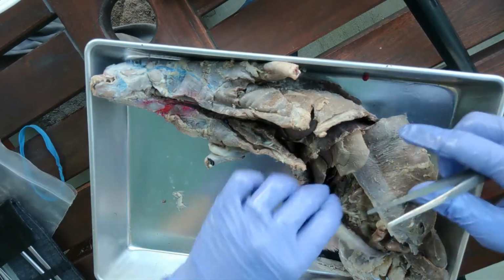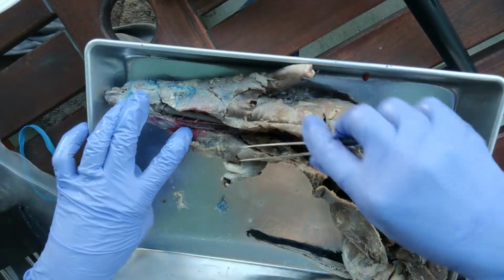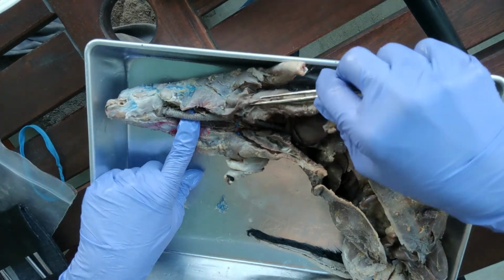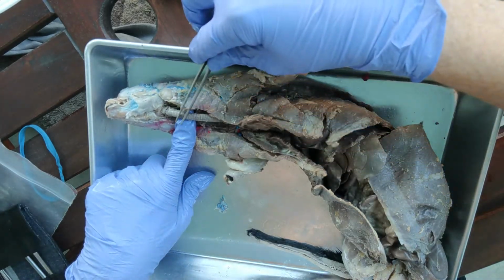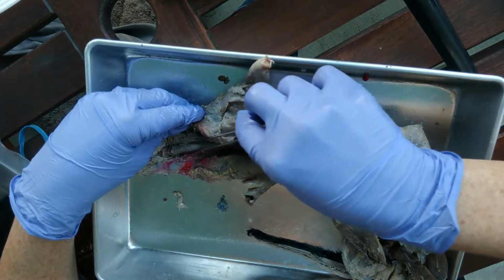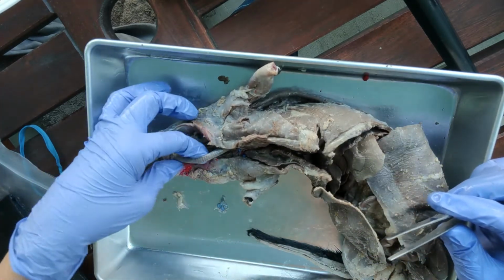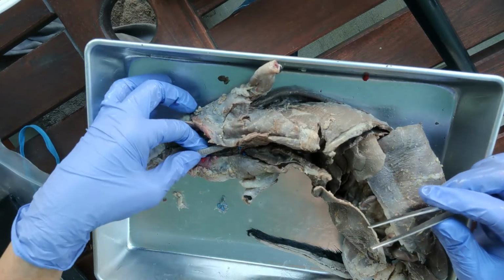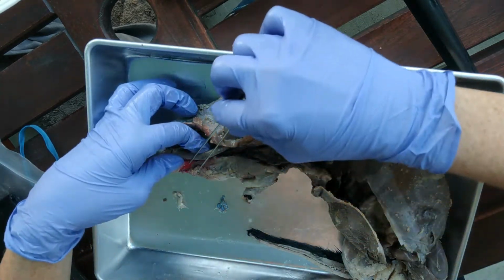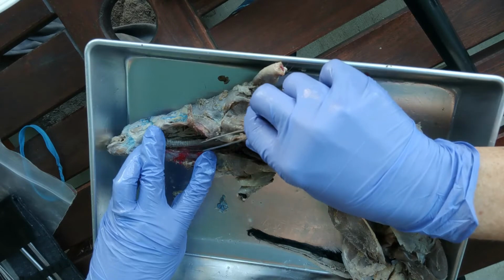Okay, so I thought I would just show you some of the internal organs of the mink. Let's start up here. So in the thoracic cavity, up near here in the throat area, we have two structures. This one right here, this is the trachea. Now the trachea has little C-shaped rings on it, and that's what gives it that stripe appearance. It always looks striped like that because it has the C-shaped rings, and if you feel it, you can feel those rings. So that's going to be the windpipe for breathing.